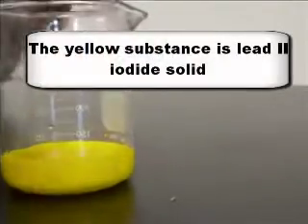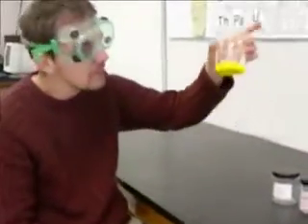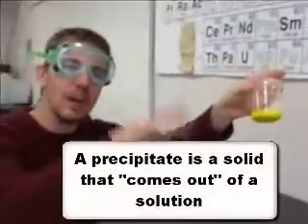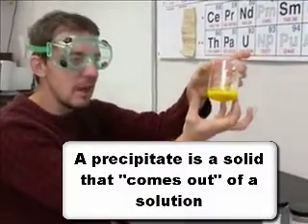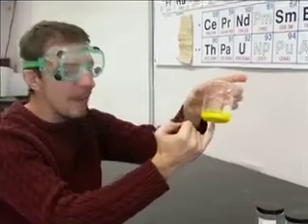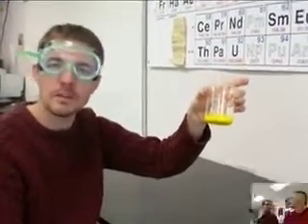Whoa! Our two clear and colorless liquids formed a yellow solid. If you get real close, you can see that it's a solid that's formed. It didn't just turn into a yellow liquid. You can see chunks settling down to the bottom. We call that a precipitate. Don't confuse that with precipitation, like rain coming down. This is a solid precipitate that comes out of the solution and settles to the bottom. So two ionic compounds in solution, mix them together, and you form a solid ionic compound that does not dissolve in water in a double replacement reaction.